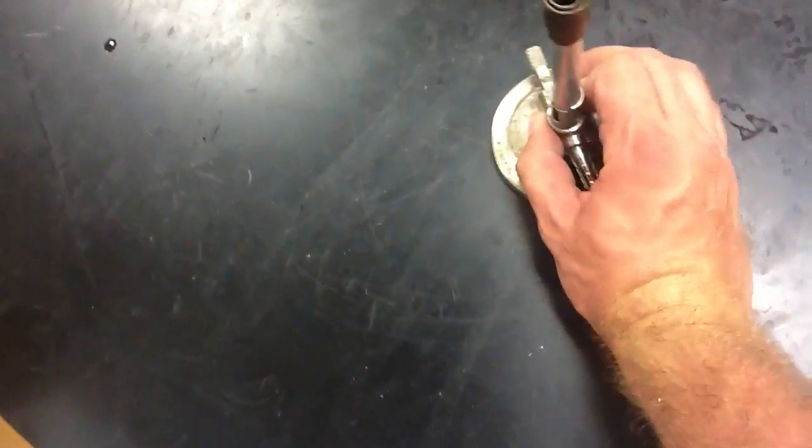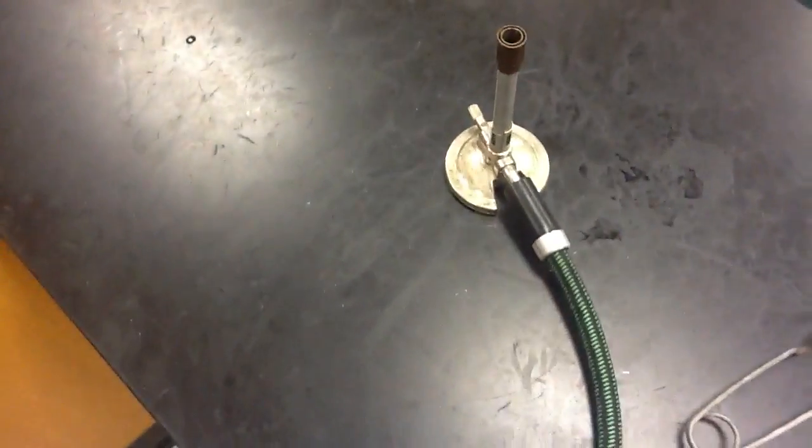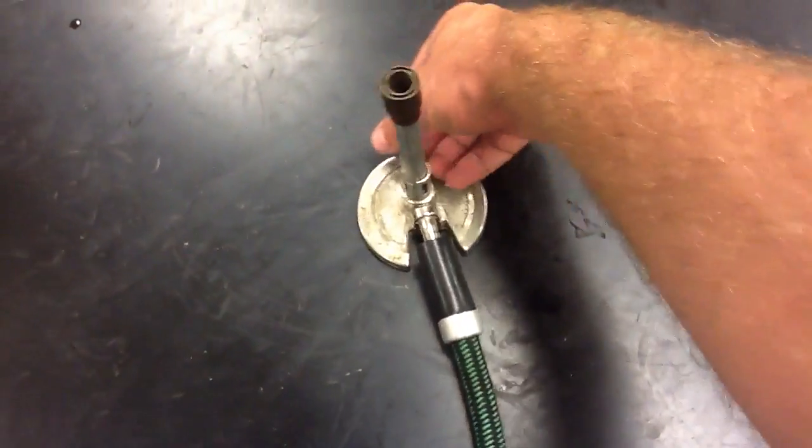It's kind of hard to do with one hand, so I'll definitely use two. Alright, now that it is securely connected to both ends, you can turn the valve.